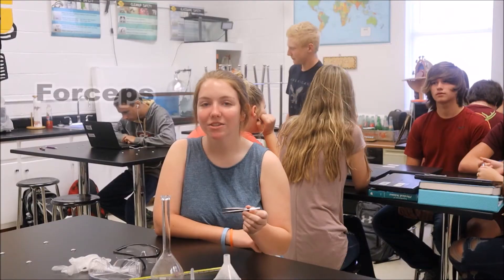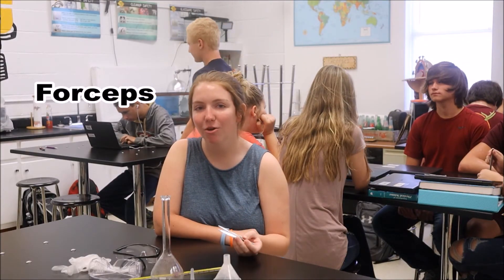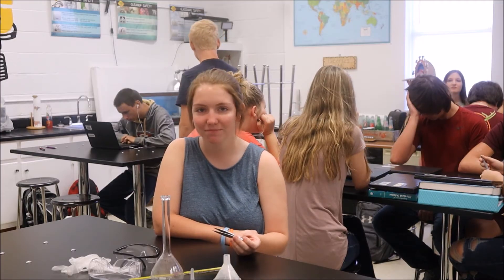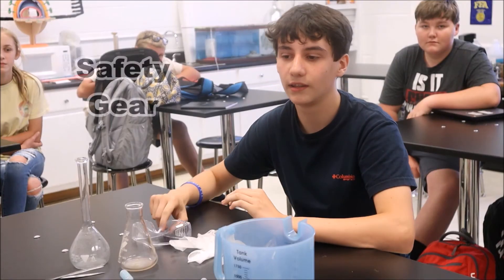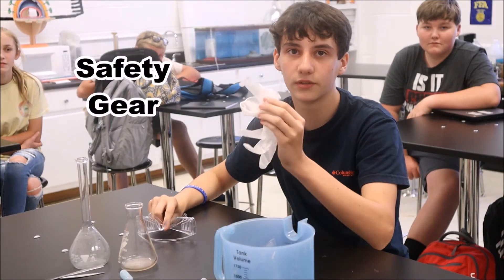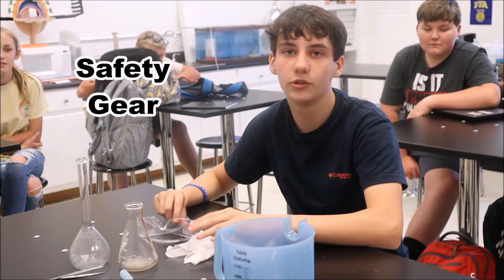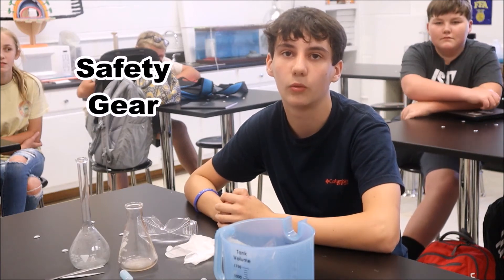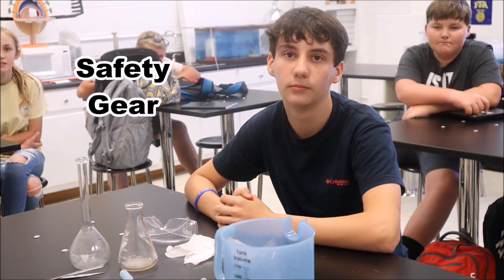These are forceps. They are used for grasping and holding small objects during labs. These are safety glasses and gloves. Make sure you always wear your safety gear while working in the lab.